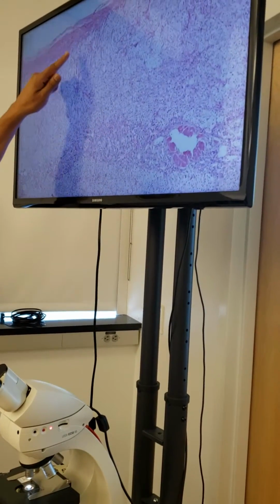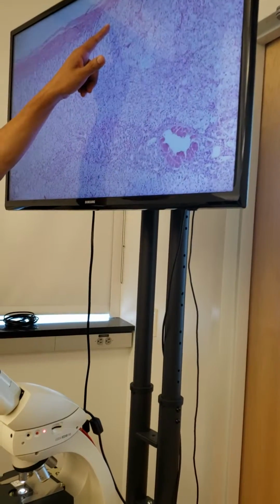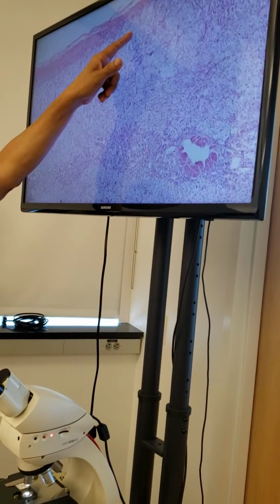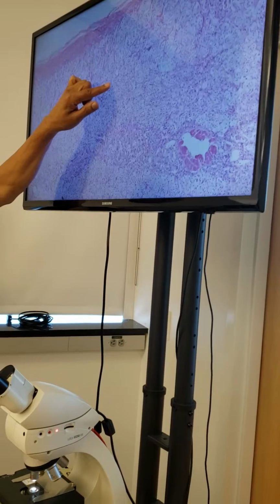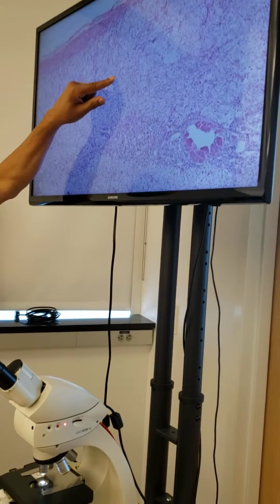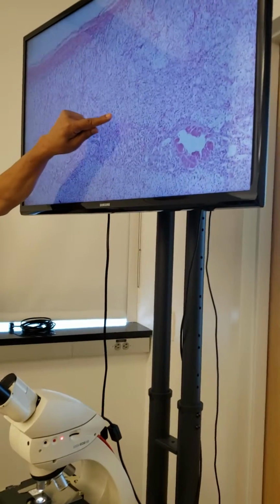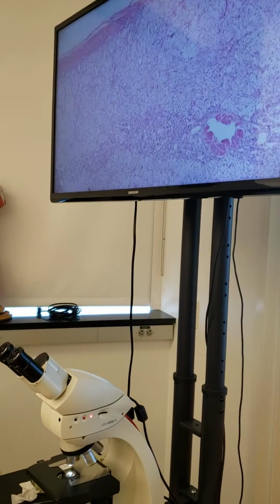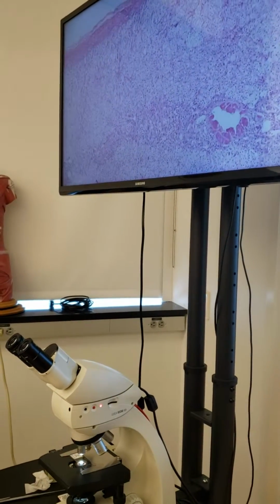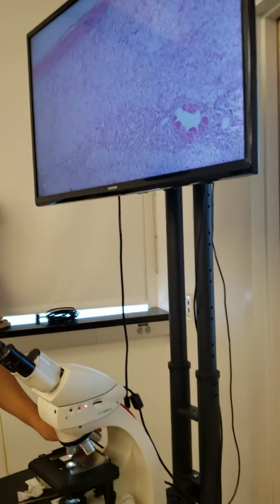From the capsule, the first one here, the outermost part is what? Zona glomerulosa. If I put the pointer in the middle of cortex, zona fasciculata. If I put a pointer here near the medulla, zona reticularis. This is how we identify. Easy? Okay. Just to show you, you don't have to know this, but let me show you.